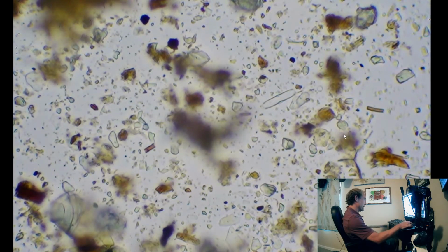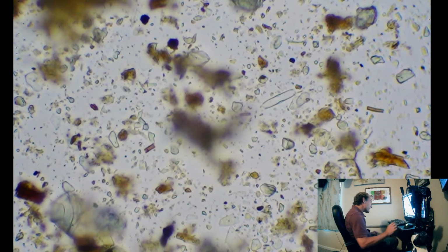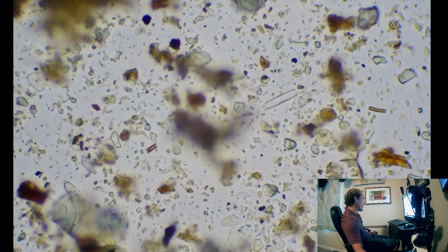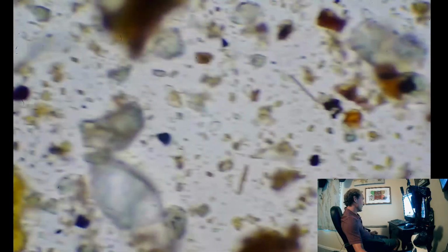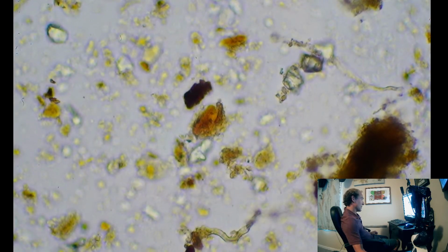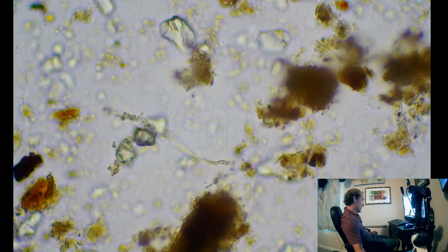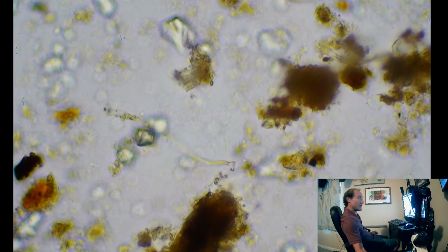That kind of looks like a diatom. I am right by the ocean, and I do add a lot of kelp, so it would explain why we would see diatoms in the soil, which generally aren't seen in there. They can be seen, but definitely more likely if you add, if you're away from the ocean, you probably add a kelp product of some sort to get them in there, or fish hydrolysate.